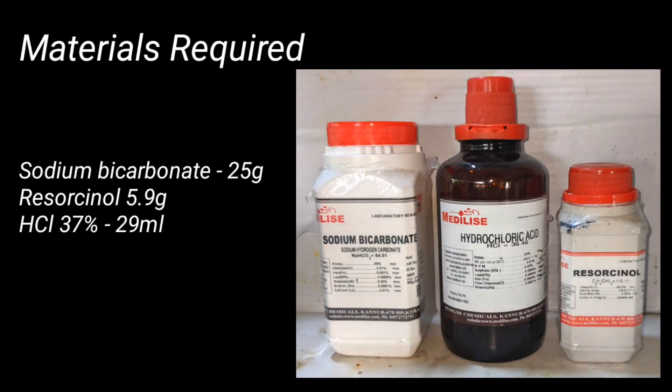Materials required for this preparation include 25 grams of sodium bicarbonate, 5.9 grams of resorcinol, and 29 milliliters of 37% hydrochloric acid.